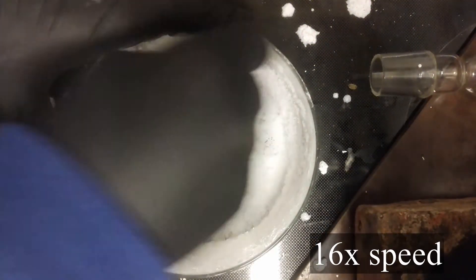Now you'll be left with a fine white powder. I prefer washing it with some HCl and maybe a few solvents like acetone to purify it, and after that crush and heat dry it again. So here it is, silicon dioxide.